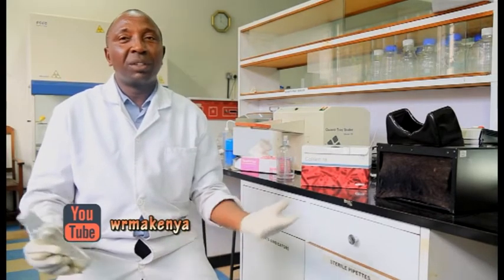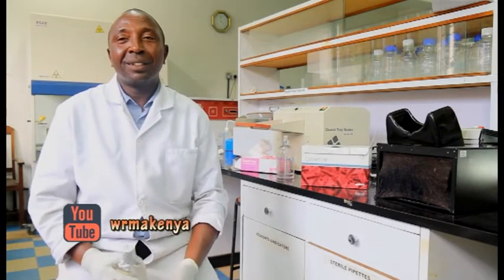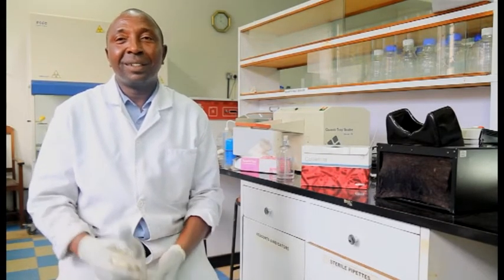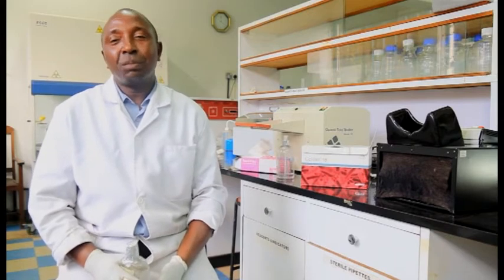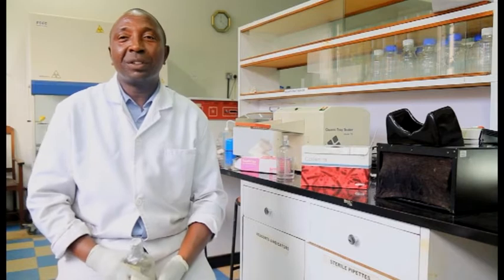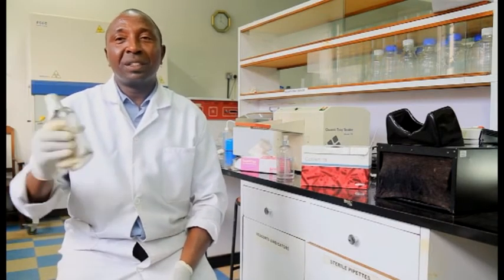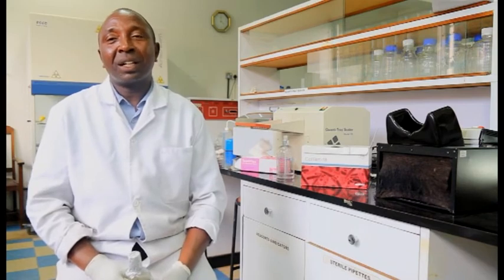So, of course, from there it's just the publication of the result in our form. And the results are ready for typing and signing by the head of the laboratory for release to our clients.